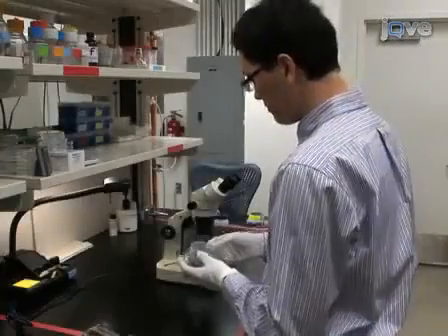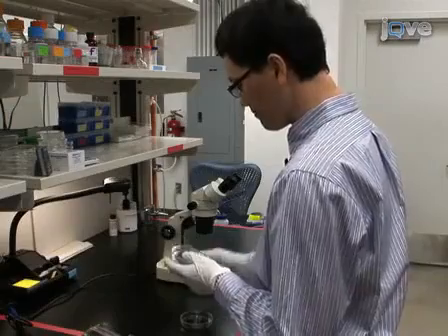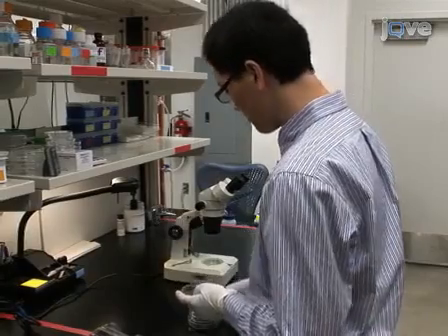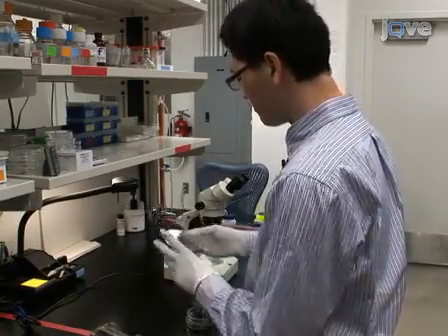Prior to experimentation, prepare a silicon master, designed and fabricated according to intended experimental use. For example, the Stanford Microfluidics Foundry will fabricate designed masters from which subsequent experimental replica molds can be made.